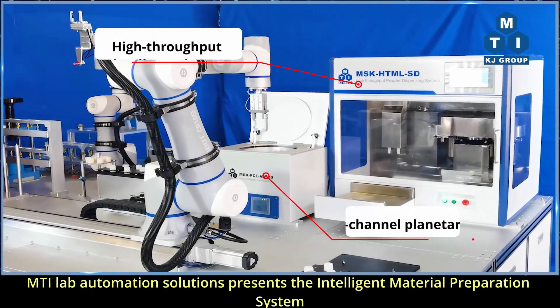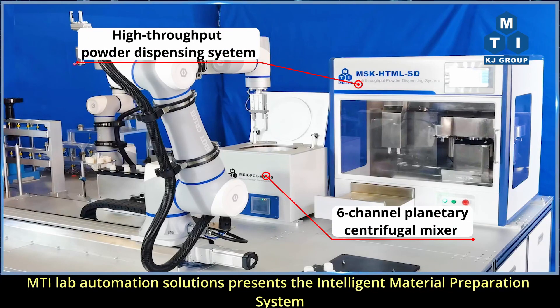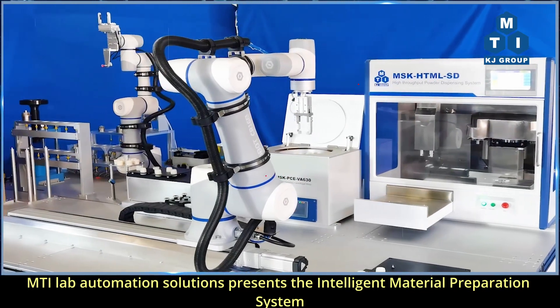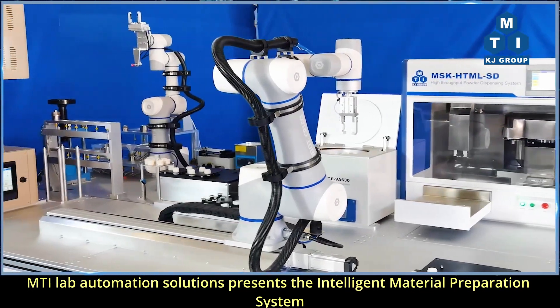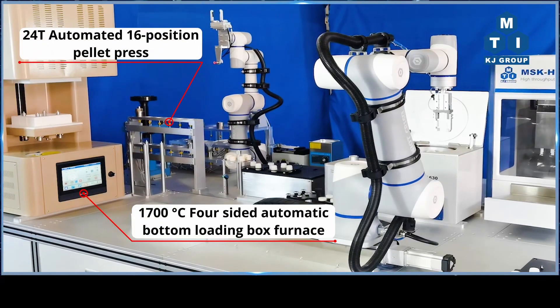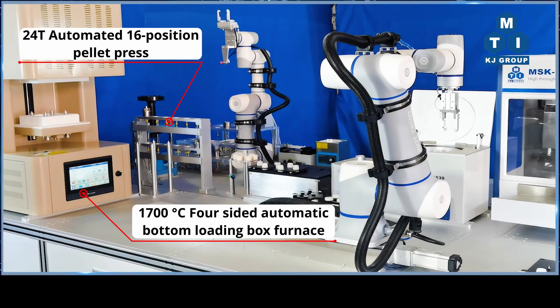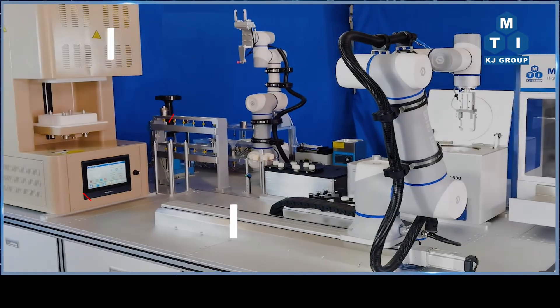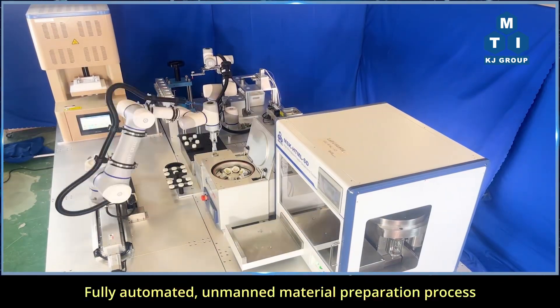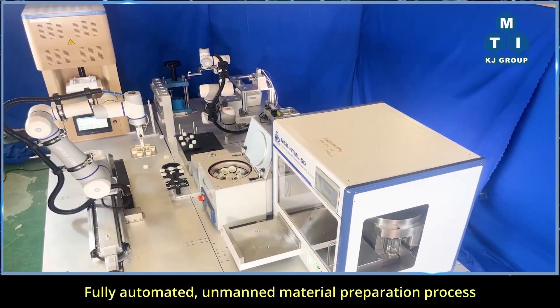MTI Lab Automation Solutions presents the Intelligent Material Preparation System. Fully automated, unmanned material preparation process.